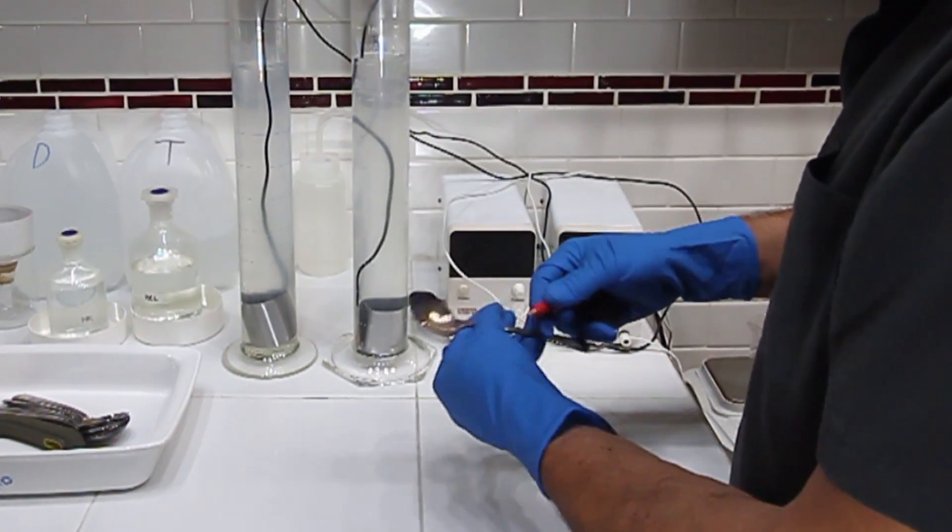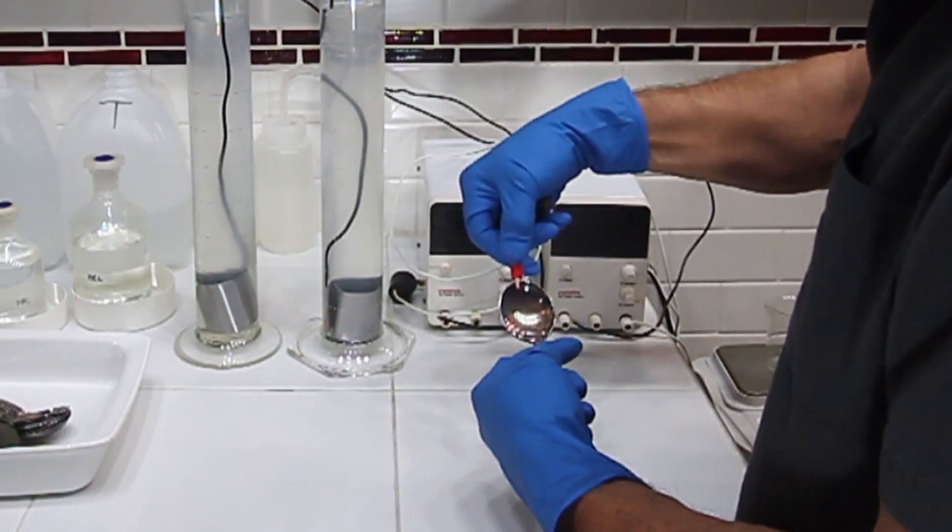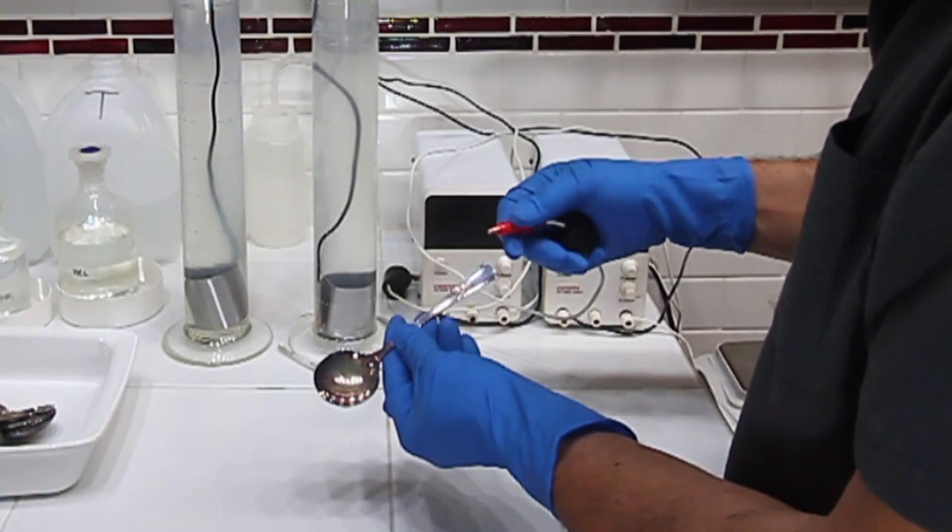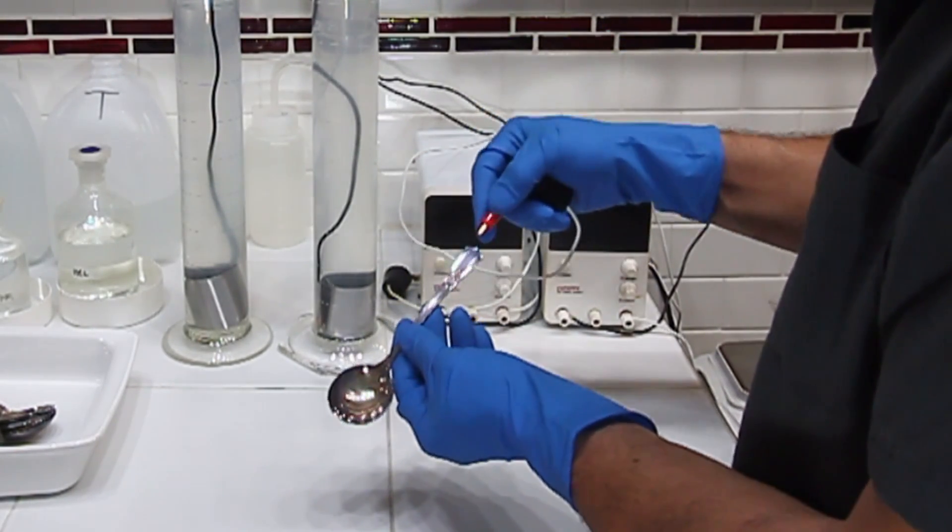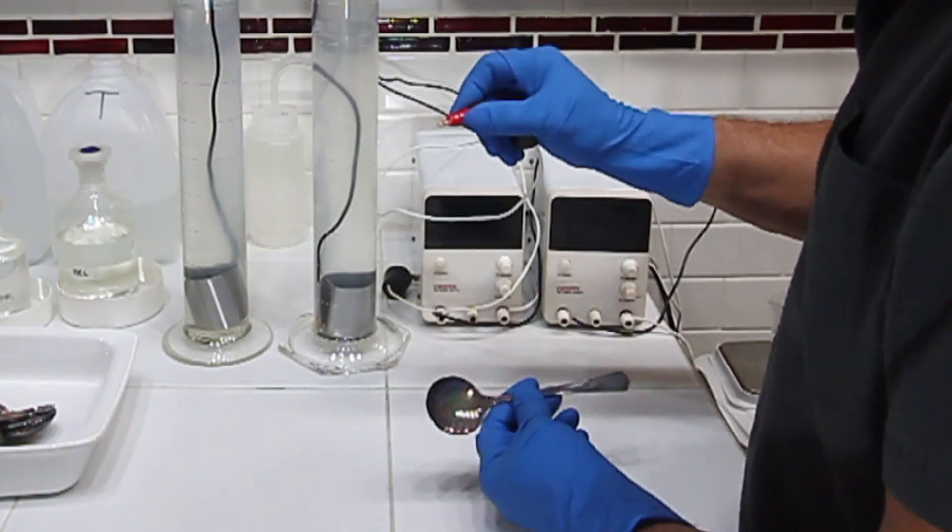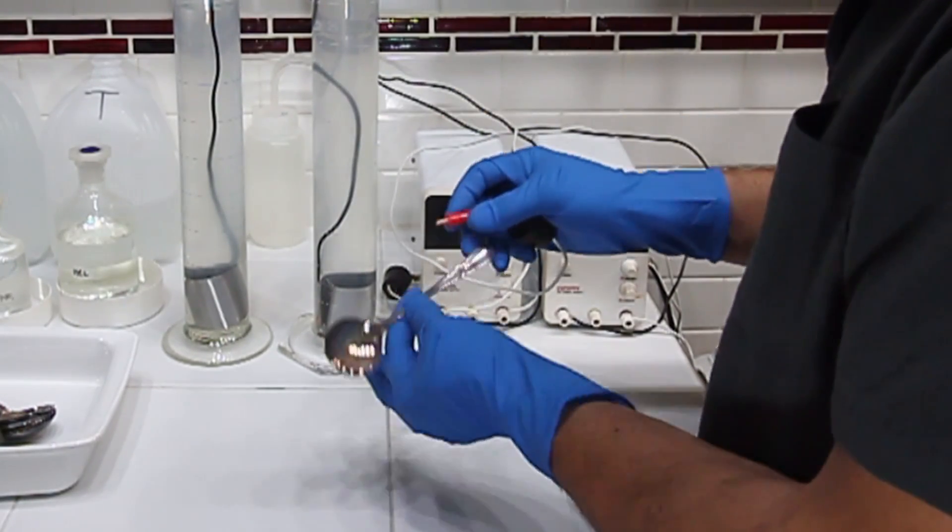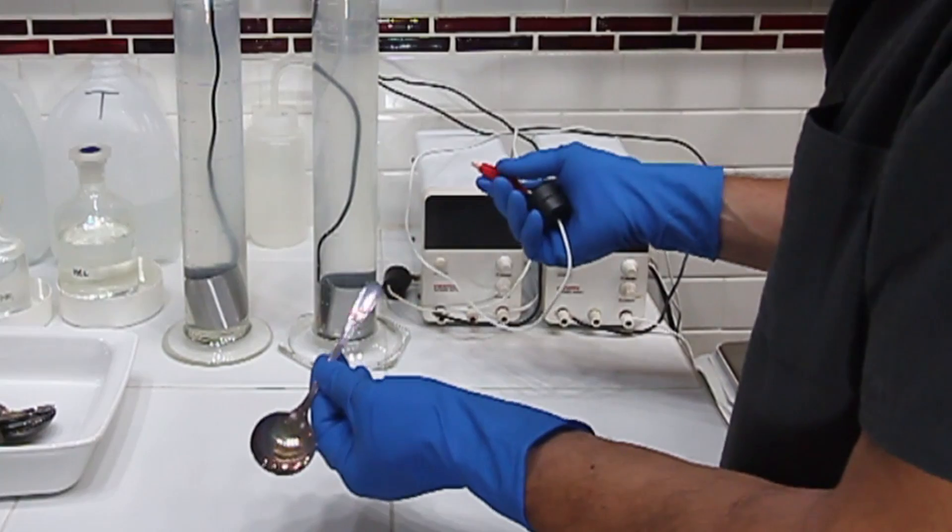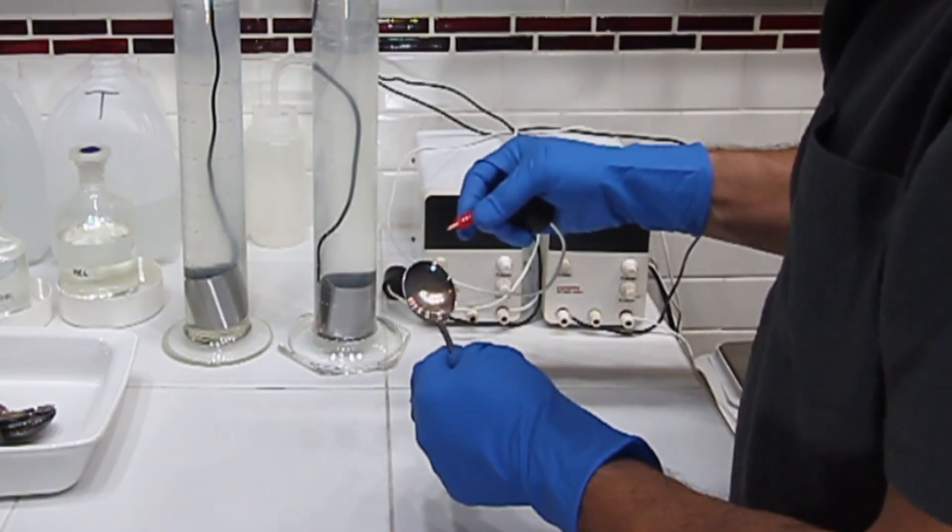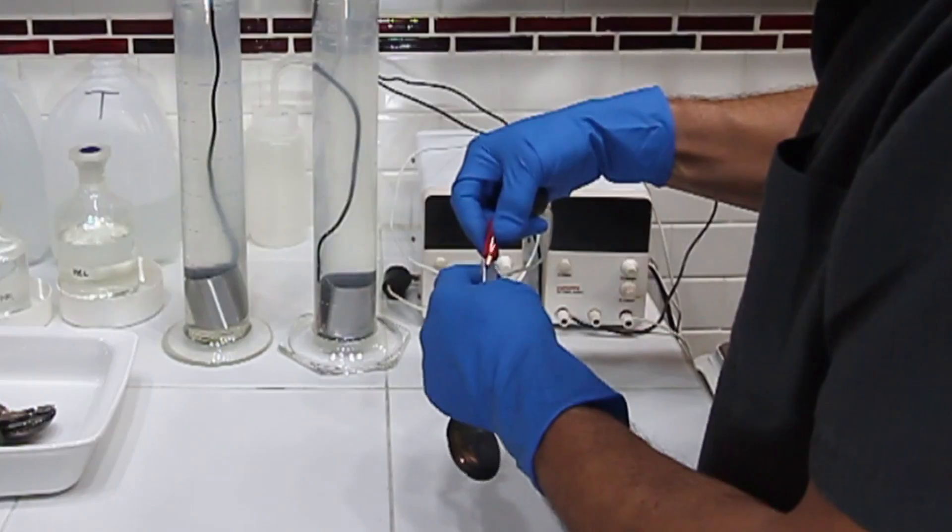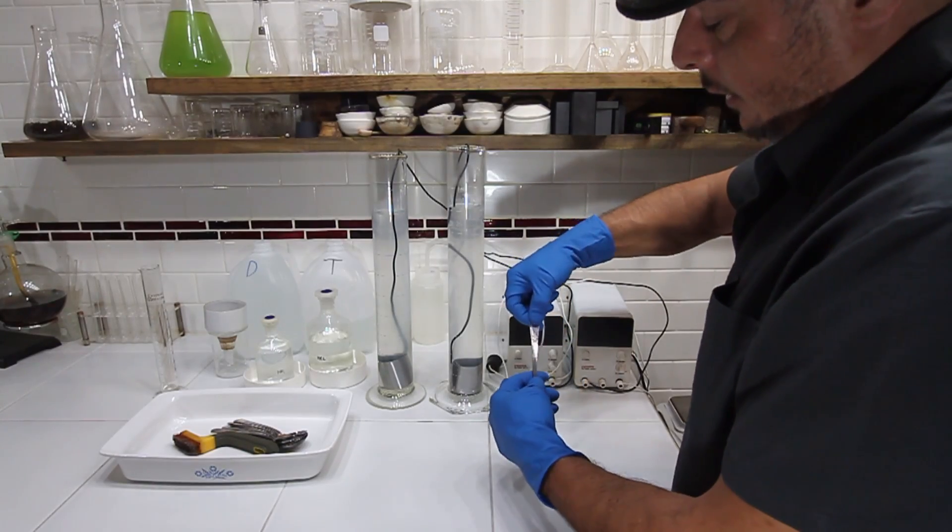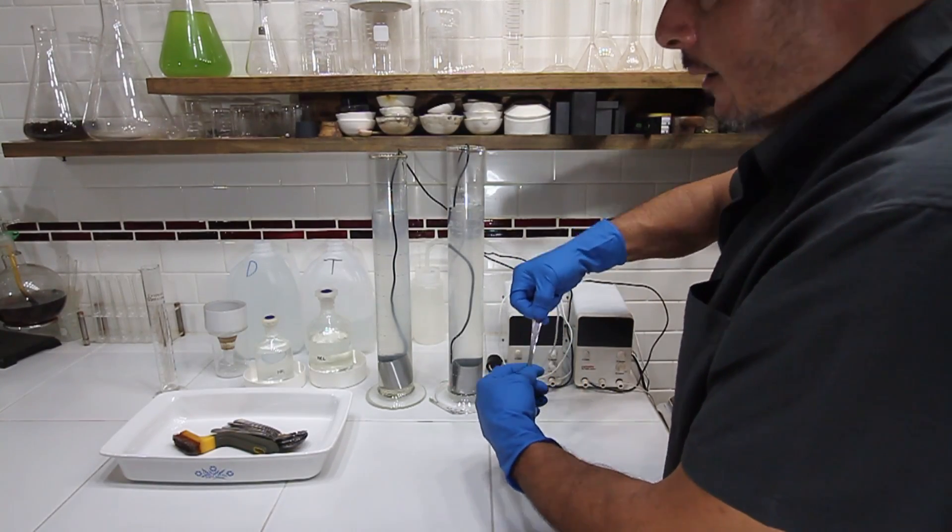I'll try to clip it in here, and you always get a little bit that's either not going to be in the solution, or if it's in the solution you corrode the clip. I've tried half and half, which also works well—actually works the best. It takes twice as long, so for this experiment I guess we'll... I have had these clips let loose, so I can dig the teeth in a little bit.